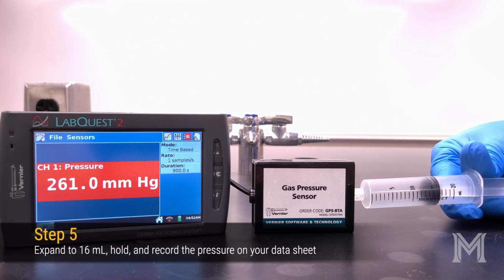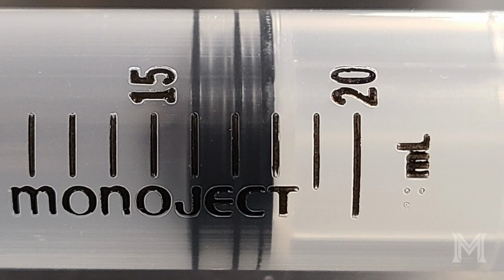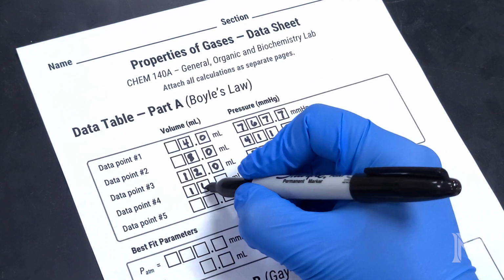For your fourth data point, we'll expand to a volume of 16 milliliters. The syringe may become difficult to hold due to the pressure difference inside versus outside. It may take several tries to get a good reading, but once you have a stable value, record it on your data sheet.